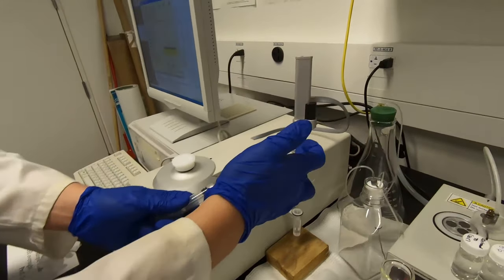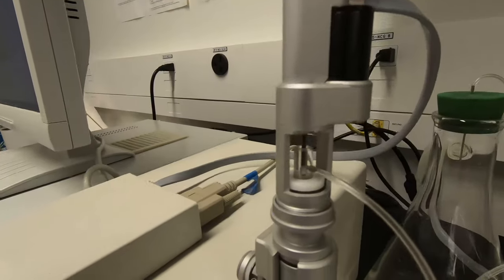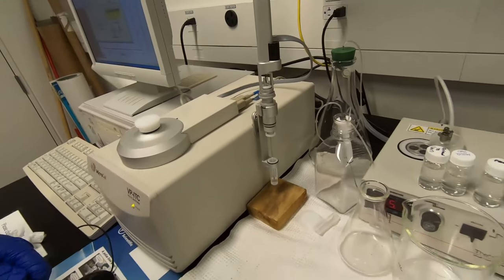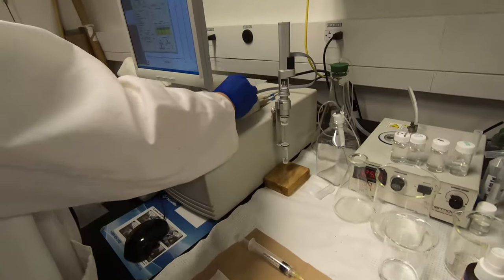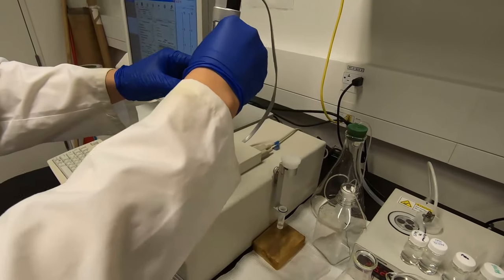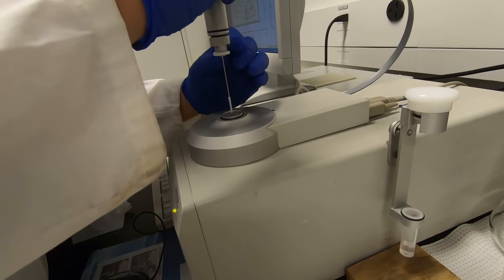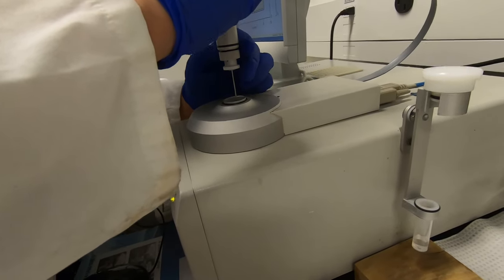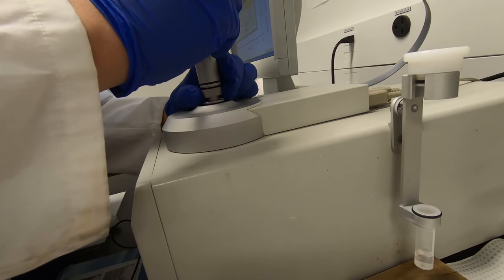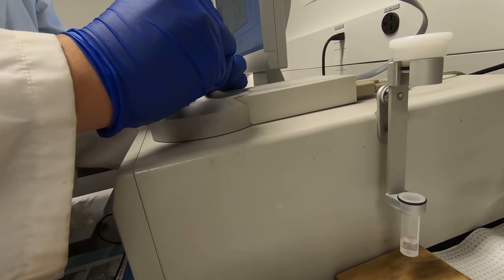When the injection syringe is filled, click 'Close Fill Port.' Now you can see it's closed. You can draw the remaining liquid out. Now this syringe is filled with water. The next step is to hold the syringe, make sure it's closed, and gently put the syringe into the ITC. It's the same as putting it into the sample cell — slowly and gently, you don't want to bend the needle. It will perfectly fit into the ITC.